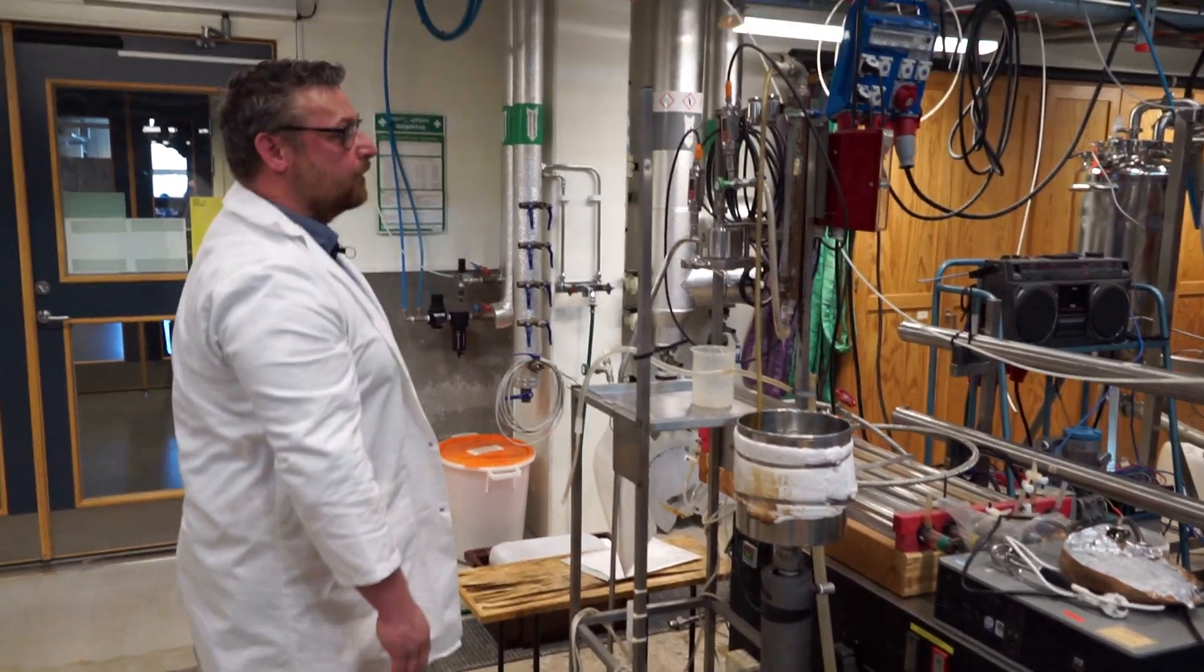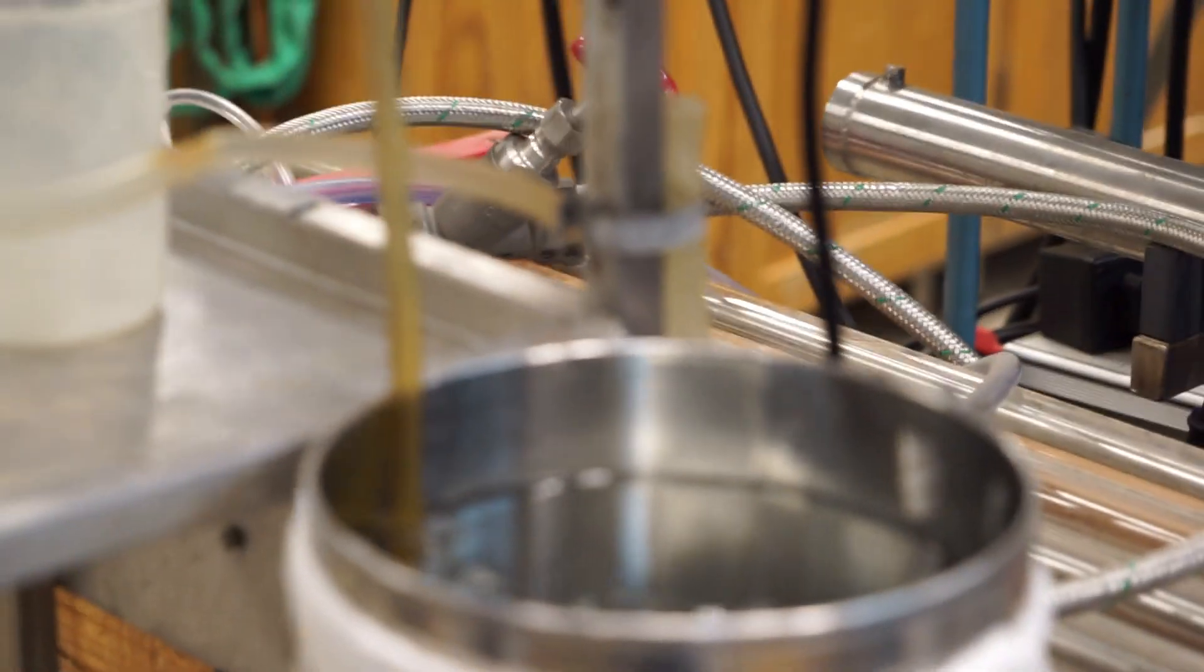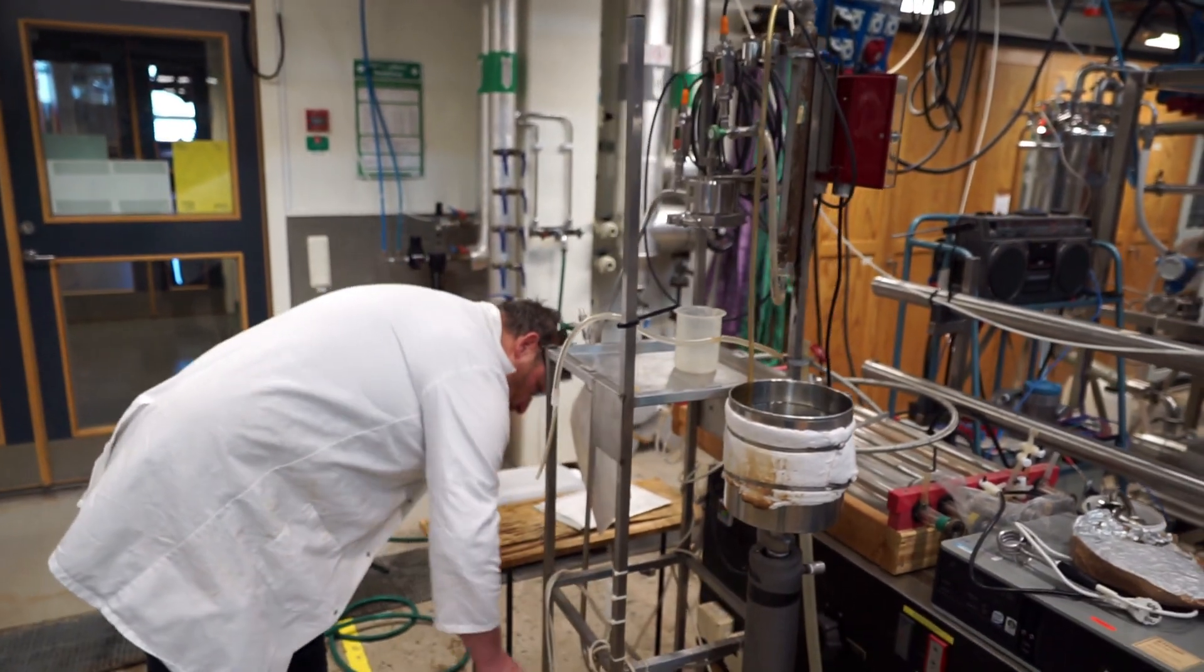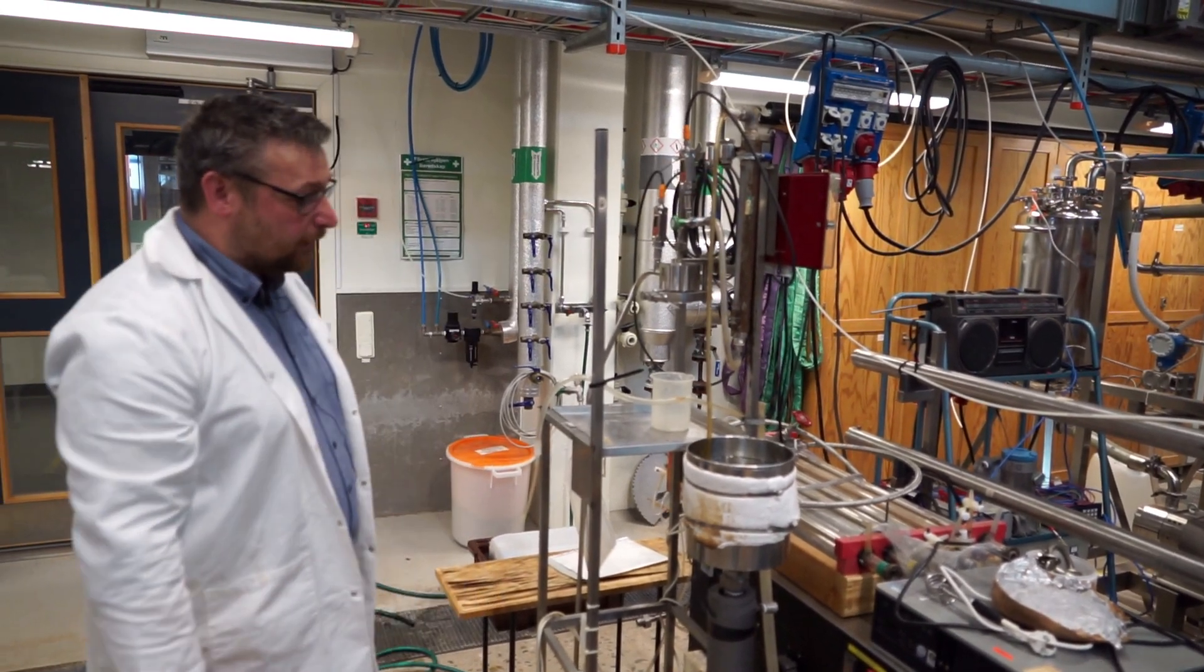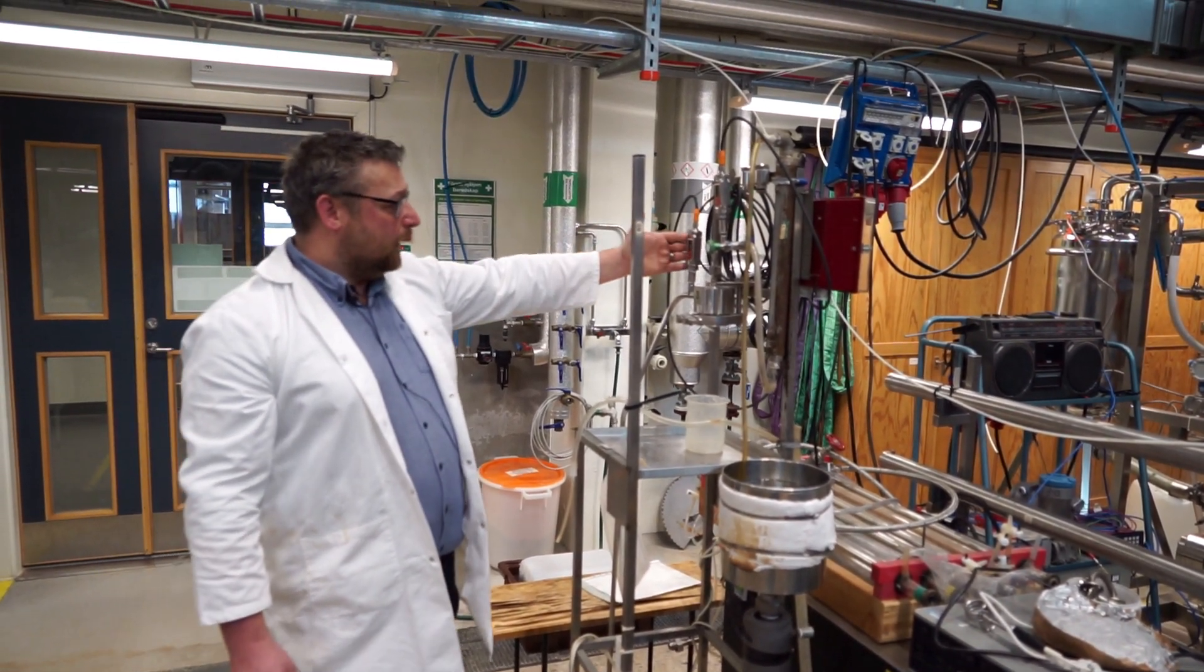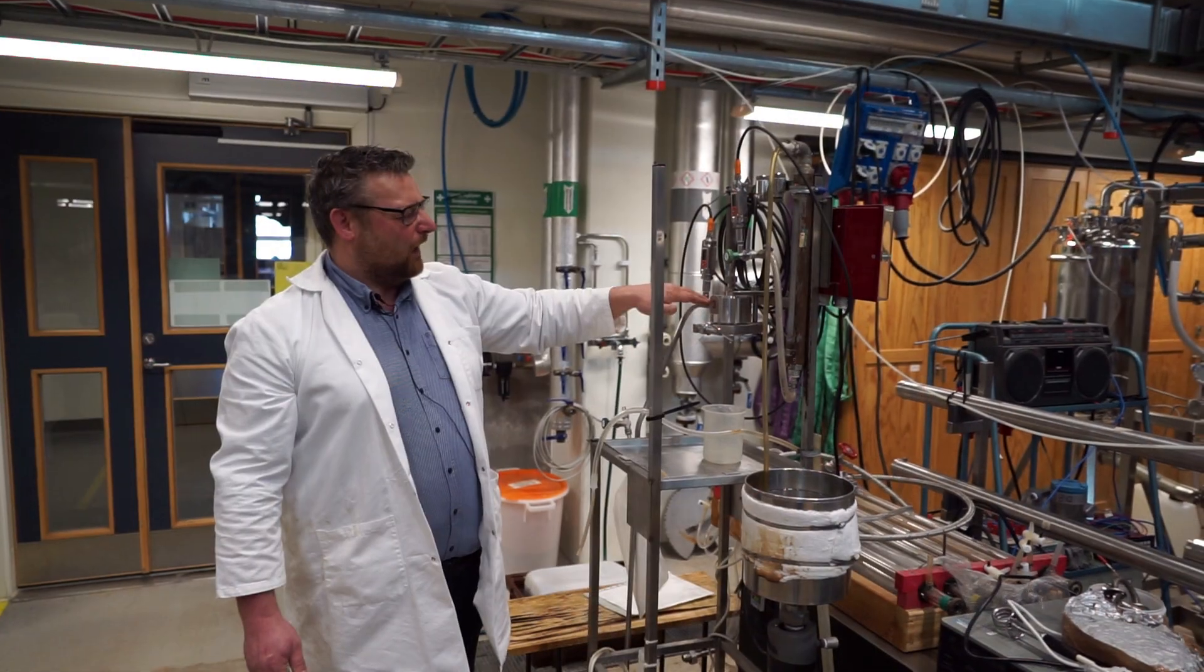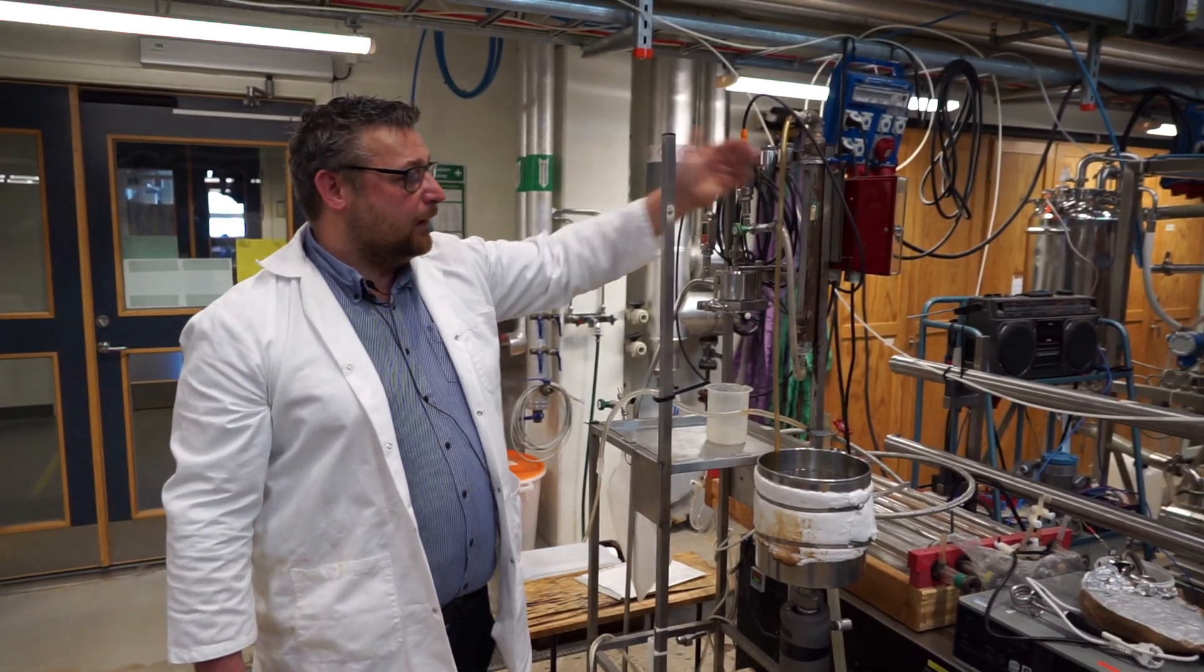Are you done? Yeah, things are happening. Things are happening. There was a little bit of air in the system. We have... That will settle in a couple of seconds. We are right now at about 40 hertz and 82% of the rotameter. So now we're up and running. We have a flow rate across the membrane. We have a transmembrane pressure. We have an inlet pressure of 0.63 and an outlet pressure of 0.56. Yeah. Well, roughly 0.1 bar pressure difference between inlet and outlet at this flow rate.